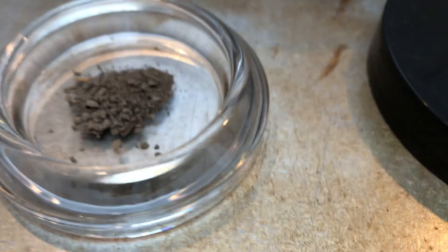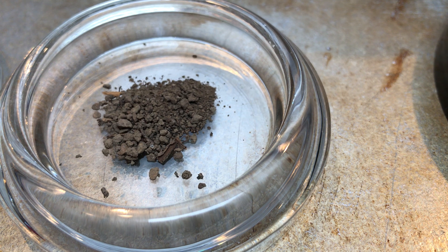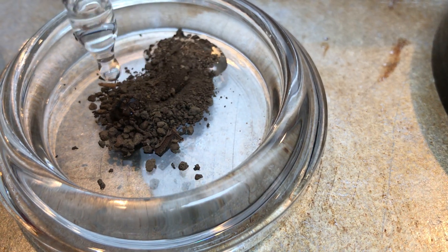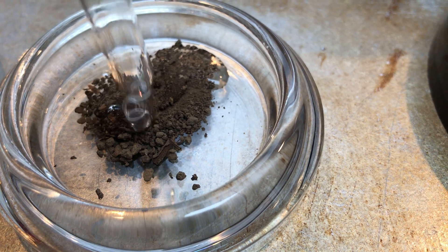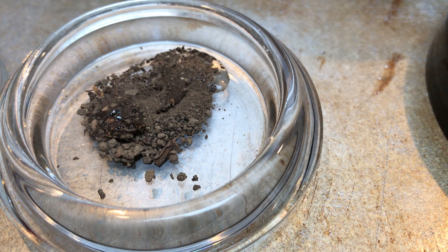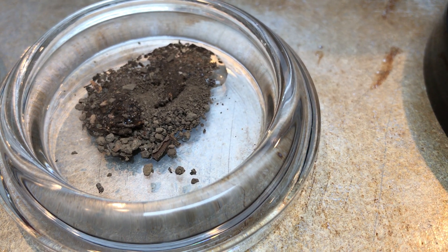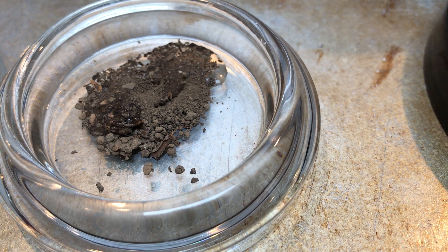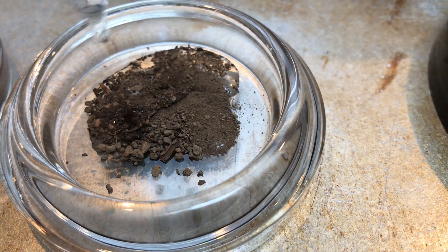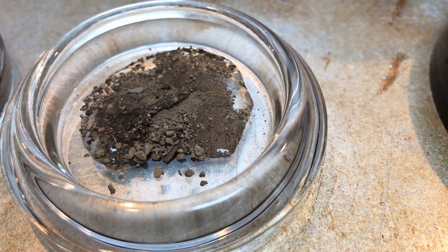Let's do the same thing with our suspect sample. A little bit more. Careful — you don't want to get the dropper into the soil. All right, good. That's pretty well saturated.